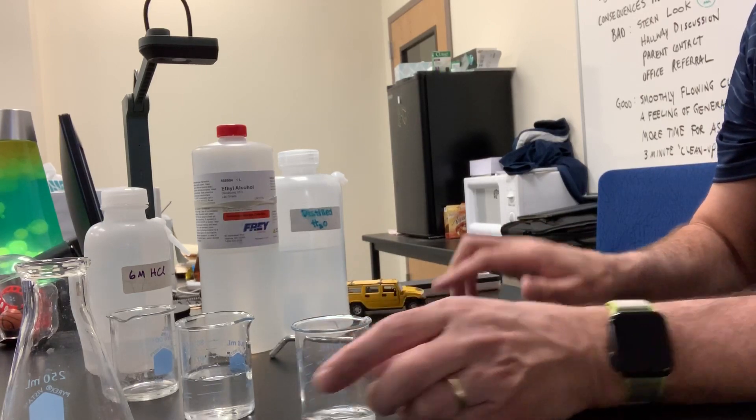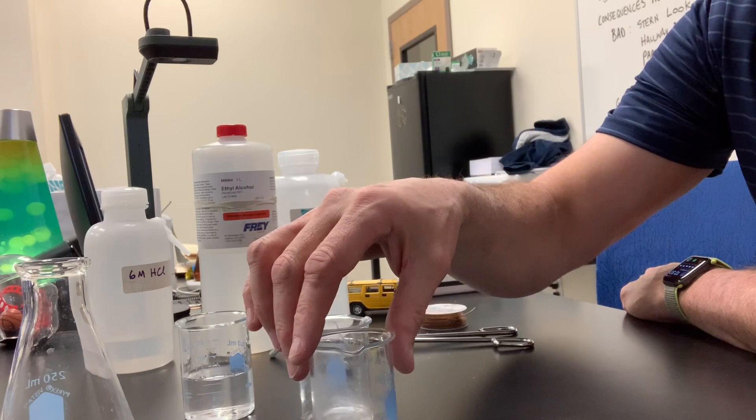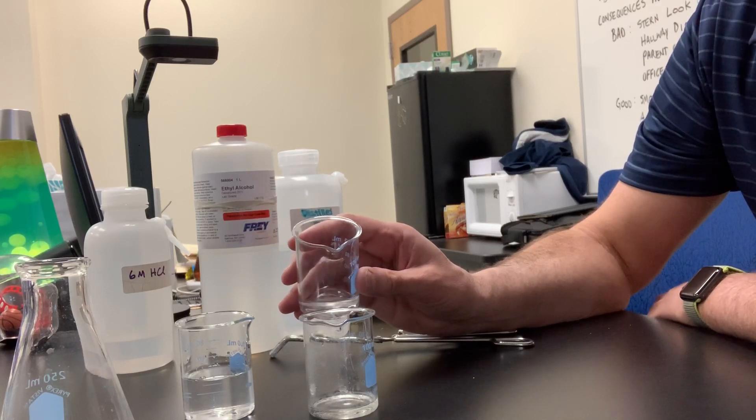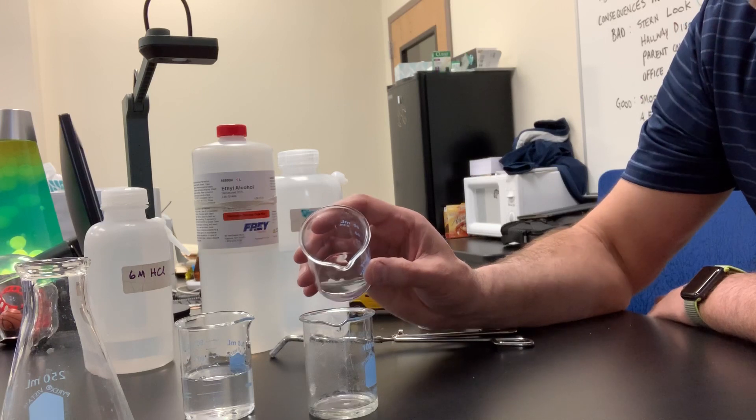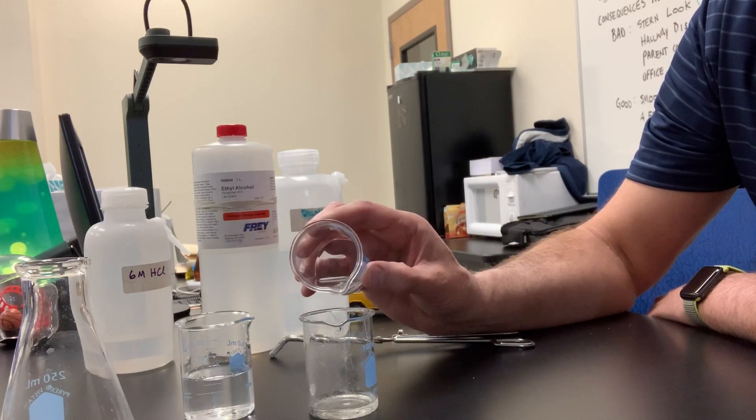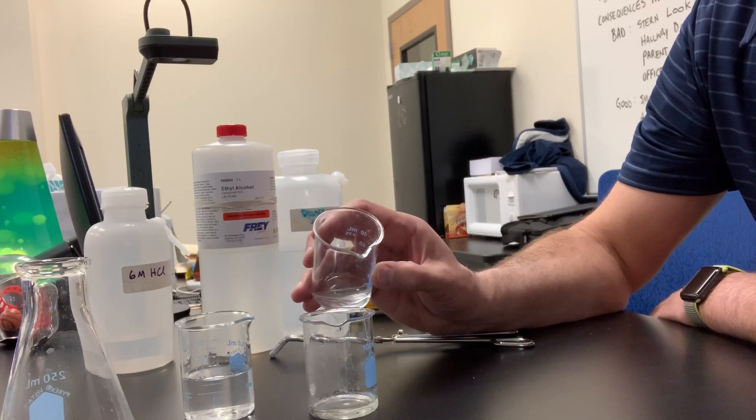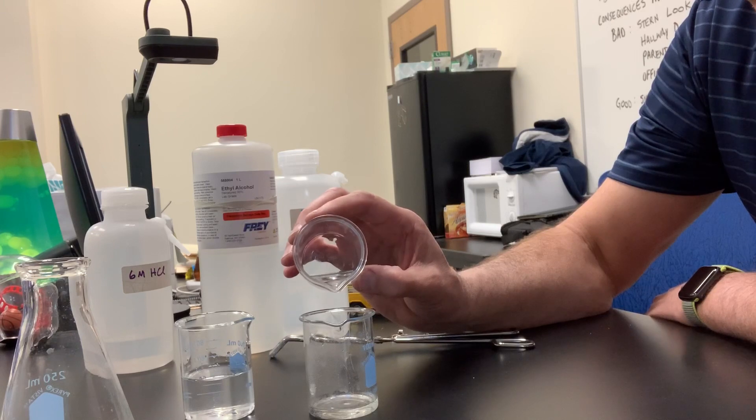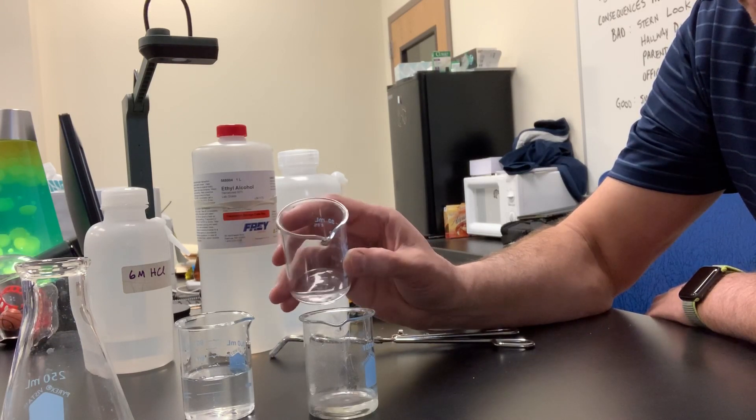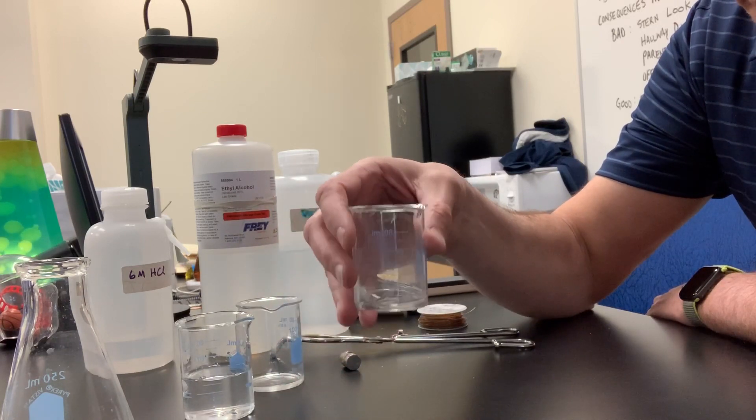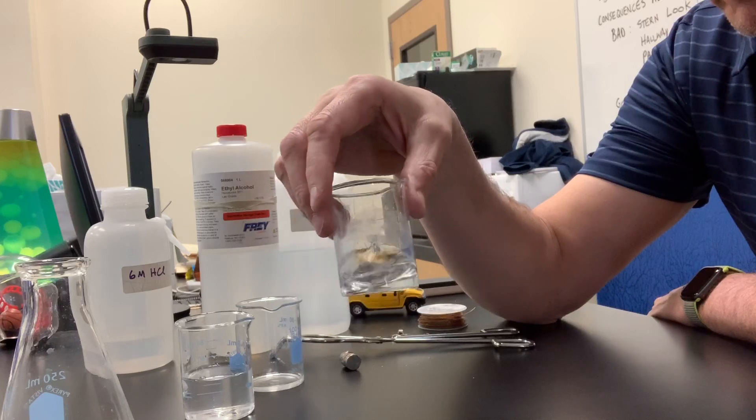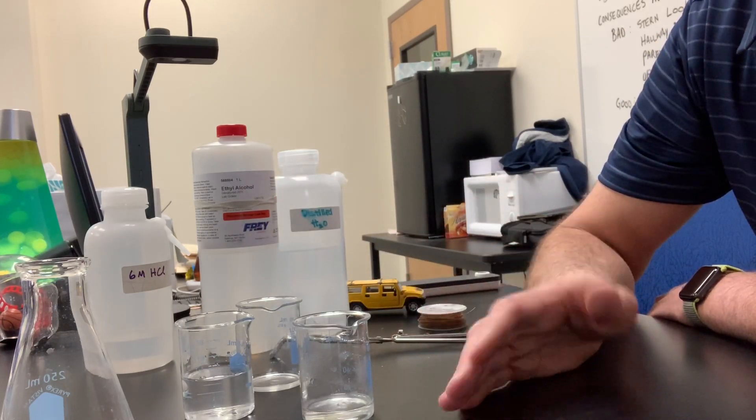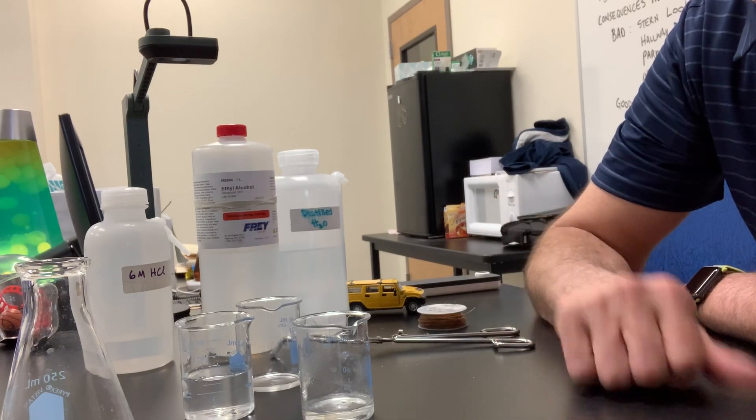How about will it react with hydrochloric acid? So, this is my beaker of hydrochloric acid right there. I've had that out now for a little while. Remember, when we saw the magnesium in hydrochloric acid, we saw a gas forming and it got warm. Let's go ahead and put the alcohol in the hydrochloric acid. We'll see if we're going to get a reaction here. You ready? So we'll look for a gas forming. Maybe it would get hot or cold. It could form a precipitate maybe. Or maybe we could see a color change. So here we go. Certainly not hot or cold. It seems to be the same temperature. Looks like it dissolved quite well in there, but I'm sorry, guys. Ethanol does not react with hydrochloric acid. Nevertheless, isn't that a property of ethanol? It does not react with hydrochloric acid.